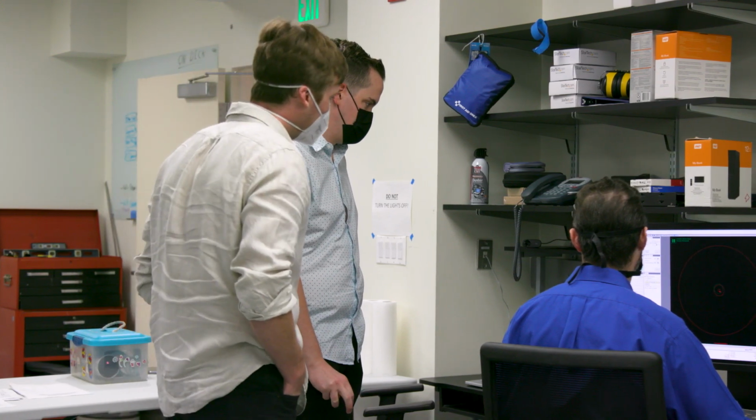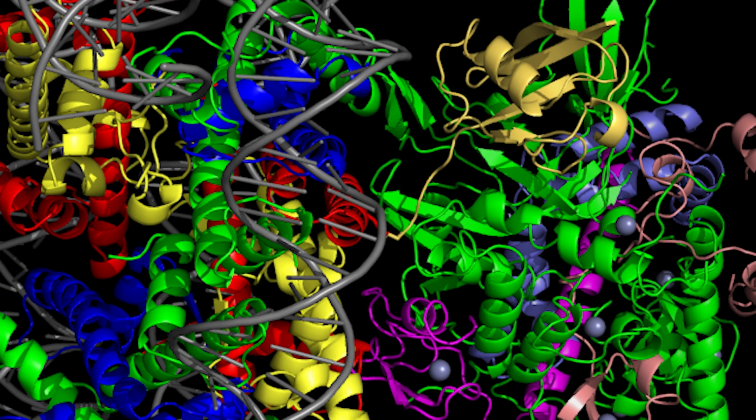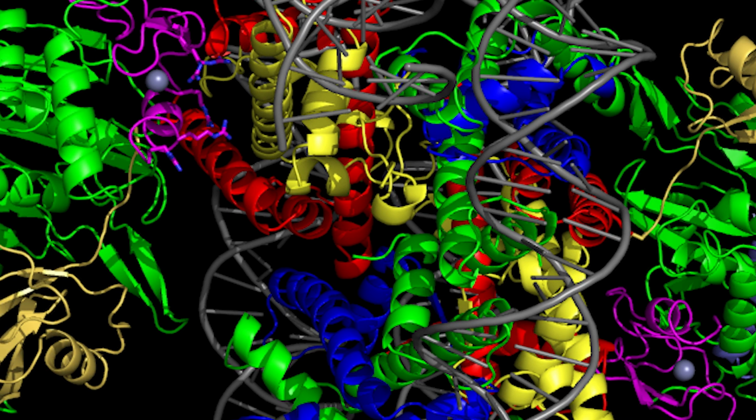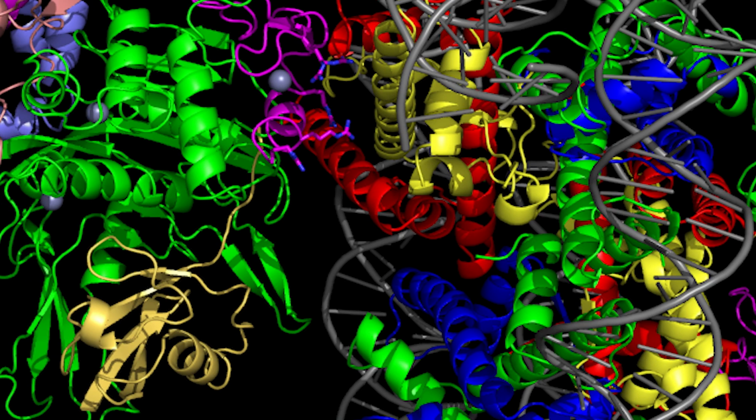One of the really exciting things is that, let's say, a patient has a certain disease. What's currently in place here at the Beckman Center is that we can take patient samples from our clinical counterparts and specifically understand what is going on with a protein that may be causing their disease. With how high throughput CryoEM is now, this may be even more informative, more accessible, and quicker than sequencing, for example.